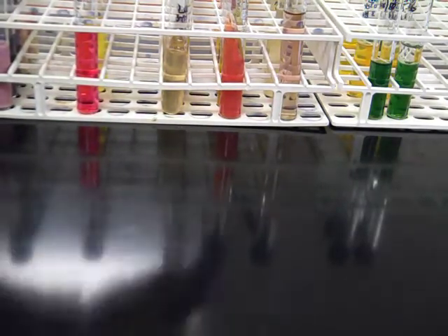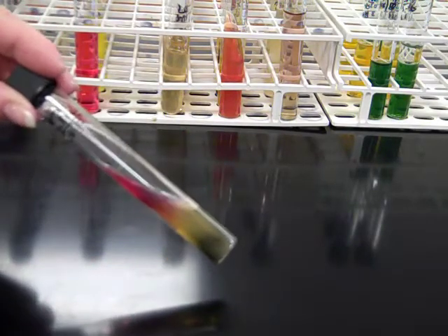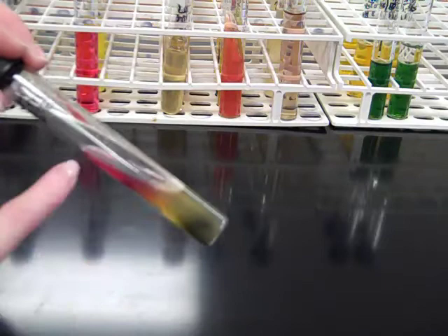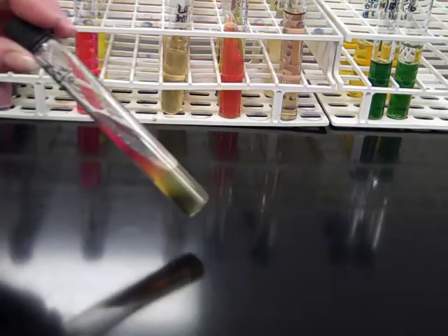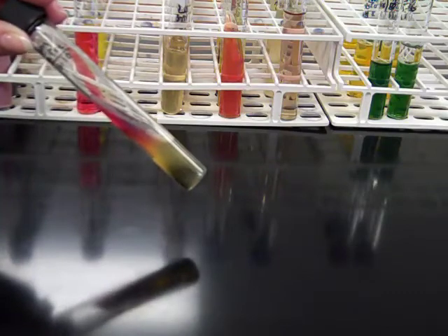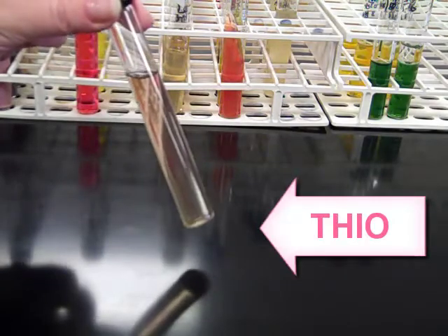In addition to sugar fermentation, you can also determine whether or not your organism is positive for hydrogen sulfide. In this case, we have a yellow butt, red slant, that tells us about glucose, and we also have a black precipitate, which gives us an indication of hydrogen sulfide production. It is positive.